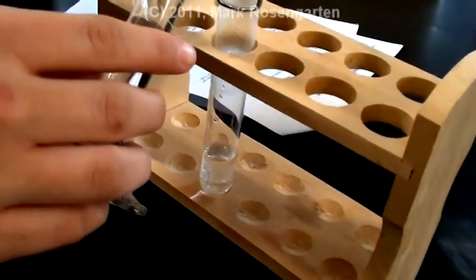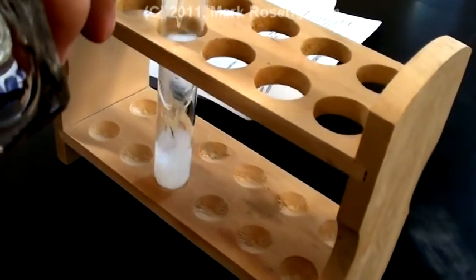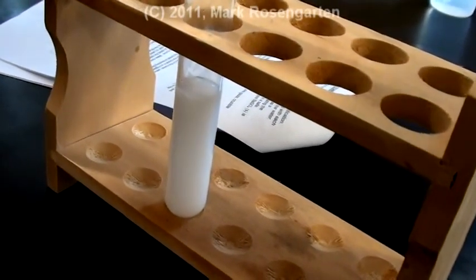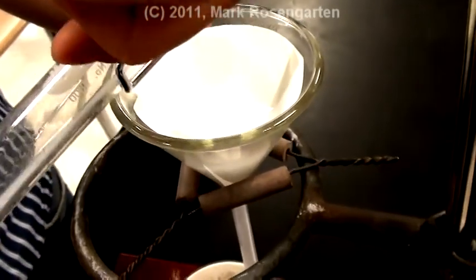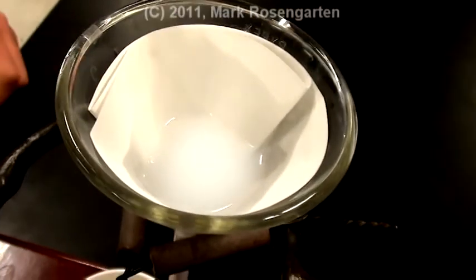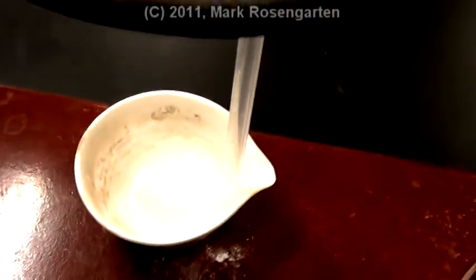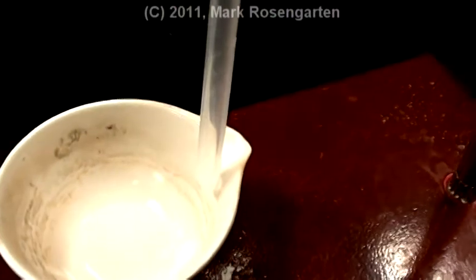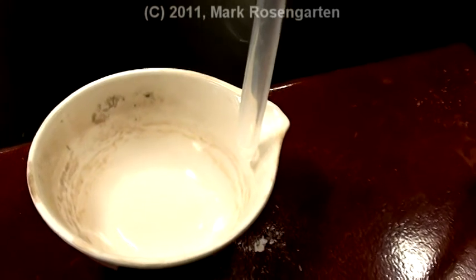Add 10 milliliters of barium nitrate solution to your sodium sulfate solution and record the results of the reaction. Pour half of your solution into the filter paper and let it filter. The barium sulfate precipitate will be left behind on the filter paper as the sodium nitrate solution comes down into the evaporating dish. Make sure the stem of the funnel is touching the side of the evaporating dish so that the liquid can dribble down in instead of dropping down in.